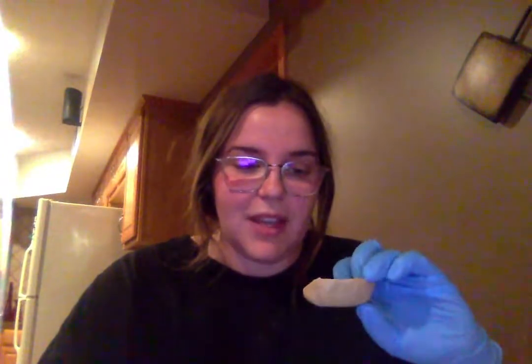It's interesting to think that there are nephrons in there, and learning about the loop of Henle and all that stuff in physiology classes and actually being able to see where it is was really interesting. I think there's a lot more that I can learn about the kidney and get a little bit more precise with identifying anatomy, but this was really helpful and I really enjoyed it.